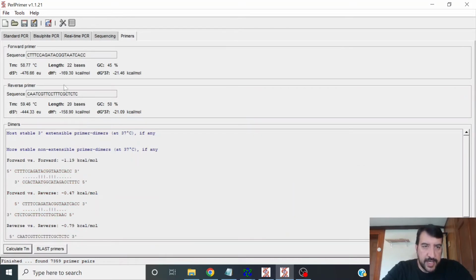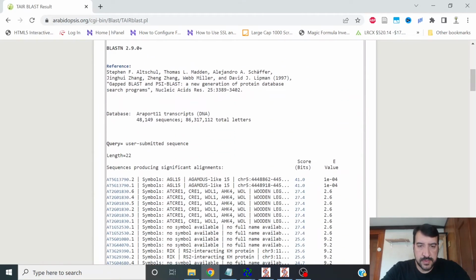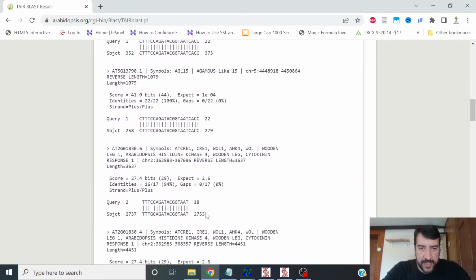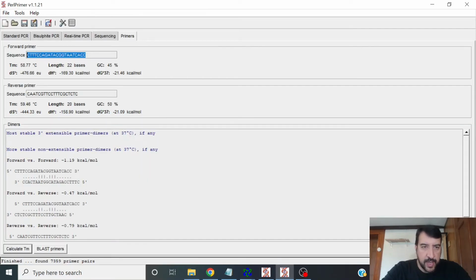And it's also very similar in that it doesn't form extensible dimers. Copy that. And here you can see that this primer is much better. So it only binds to AGL15, as you can see here. These are two different splice variants of AGL15. The next best one does not match perfectly. And you can see here that we get 16 out of 17 base pairs for that. So that would be a great primer. And let's go ahead and blast the other one and see how that looks.